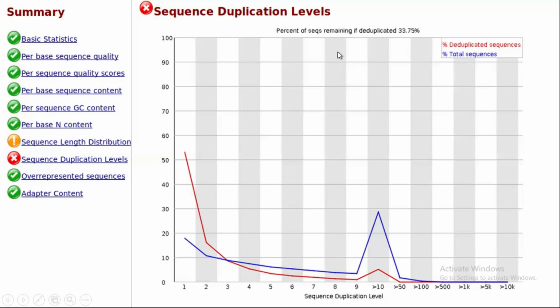So, percent remaining if deduplicated. There is also a range of duplication. Here it does not follow the threshold, so basically here is an error. And in pre-processing, there is a command that, when we use it, removes the duplication. But you have to understand what duplication is. Duplication is basically the repetition of an entire read. For example, if you have read 1 and it is duplicated 10,000 times, it is an issue, so you have to resolve it.